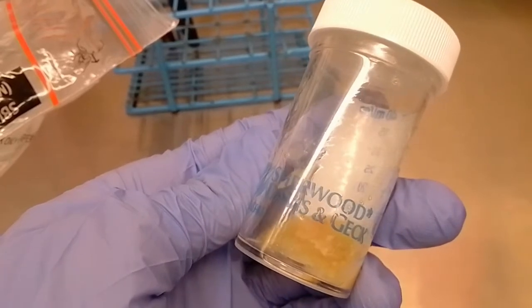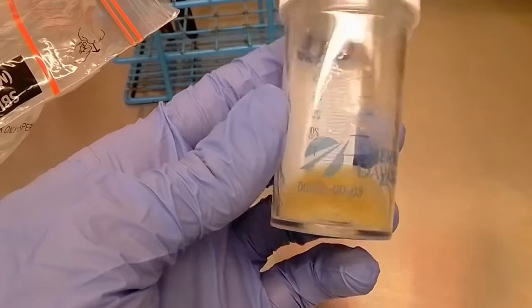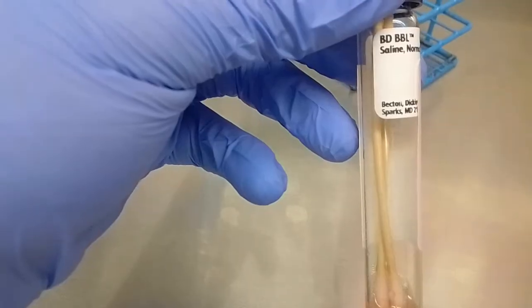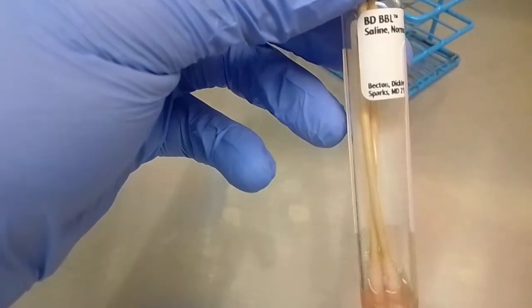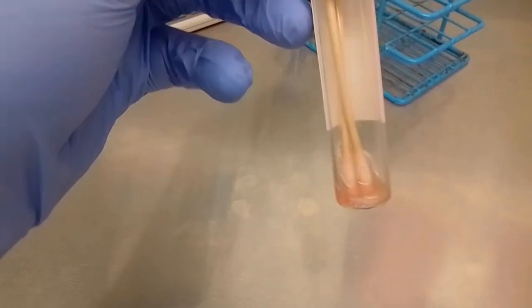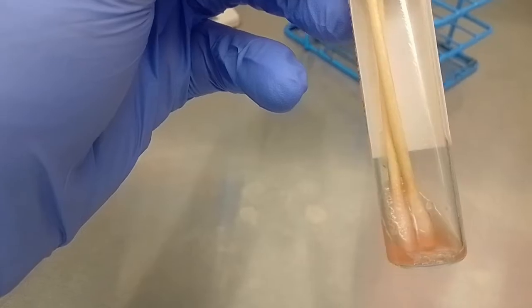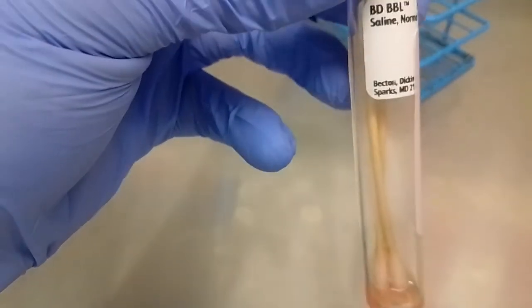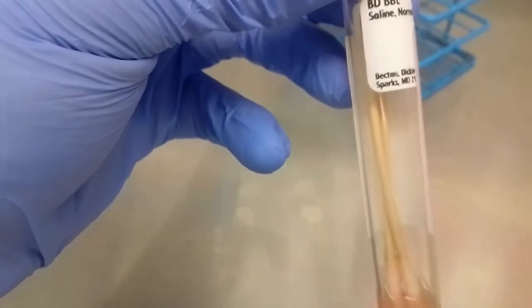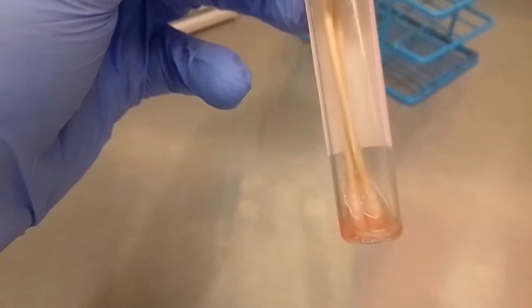If your specimen is urine, that's pretty straightforward — you collect it aseptically in a sterile cup, which is what we do in the lab here. If it's sputum, same type of thing, or if it's a tissue collected surgically, it's pretty straightforward. For something like a wound or anything else that requires a swab, you have to use a particular type of swab to collect that.